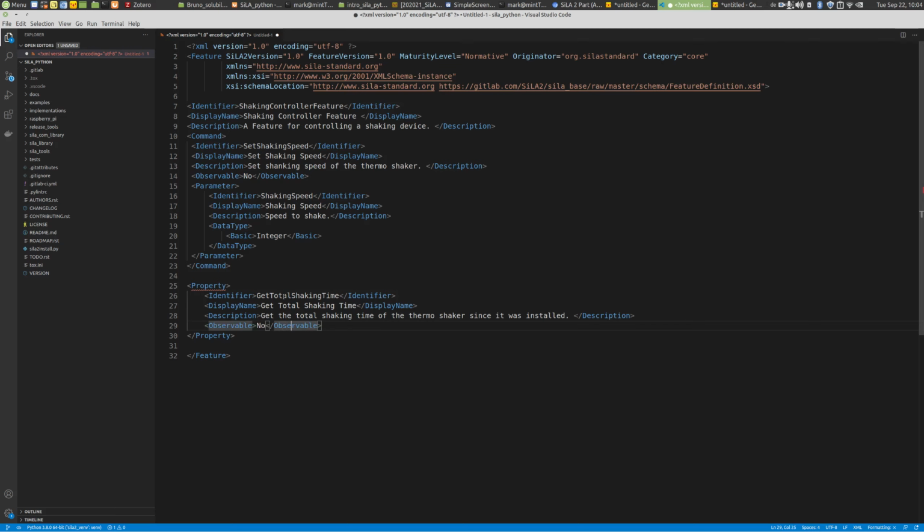We don't need an observable property here. And then the data type should be basic, so that this is the type of the return type, and then we could return an integer, for example. We should also specify in which unit. This is in hours. So, okay, this is how we specify a property.